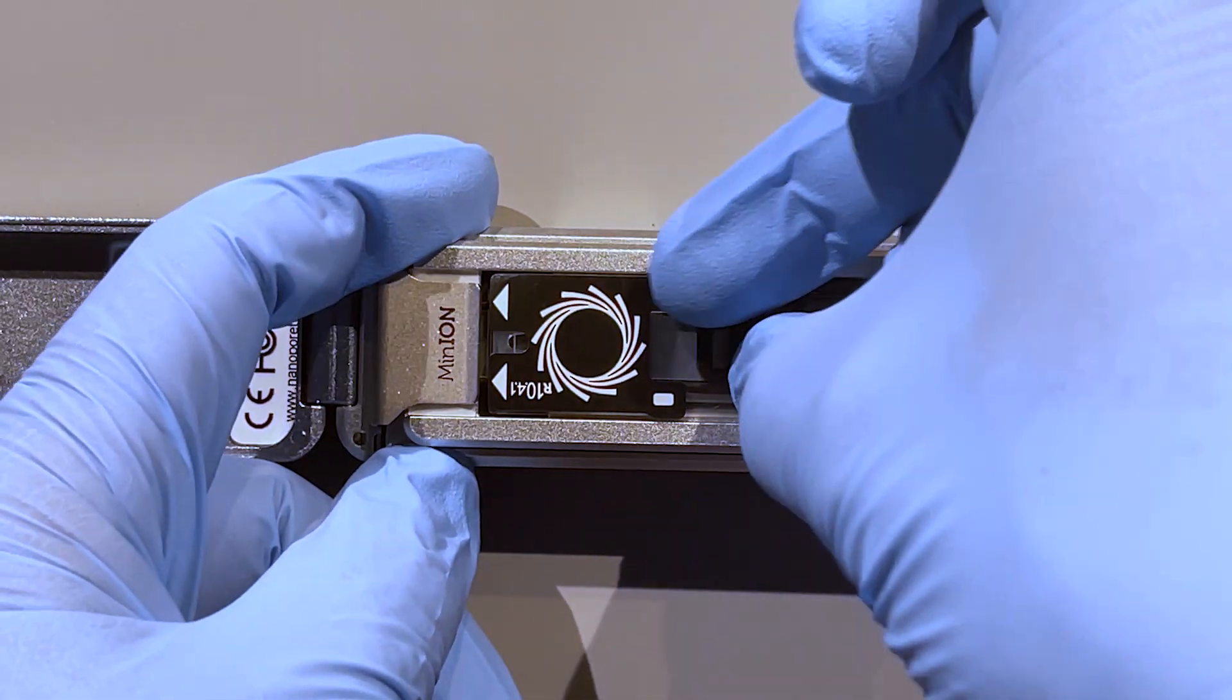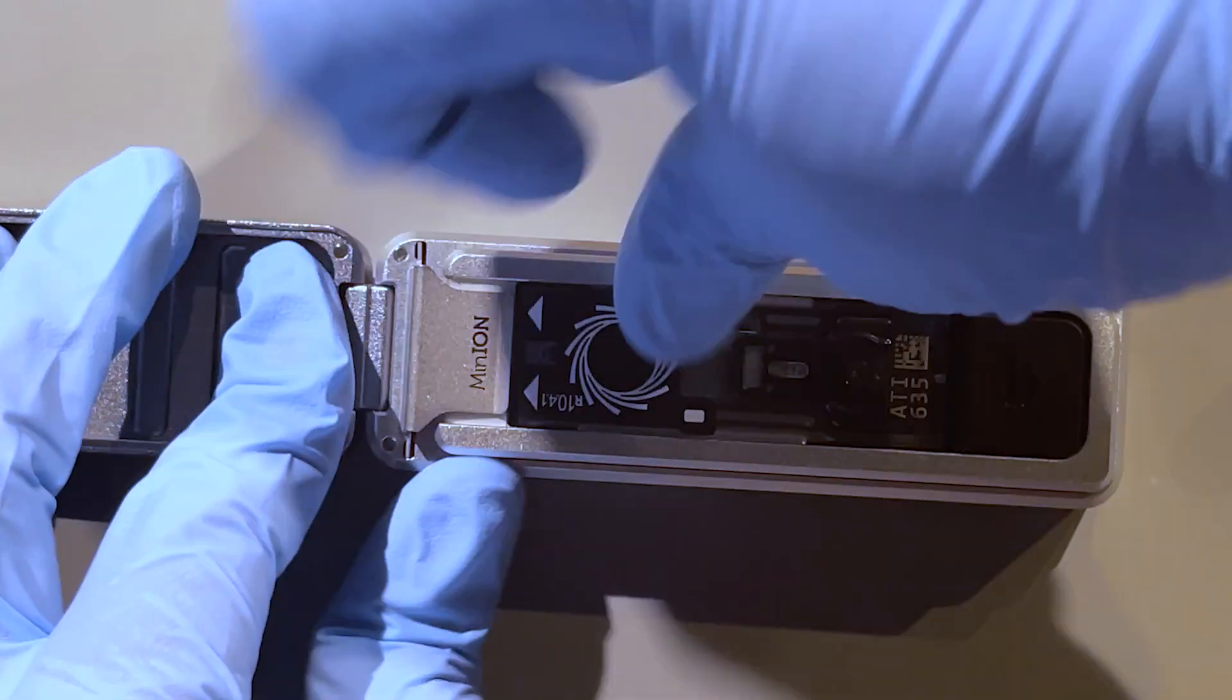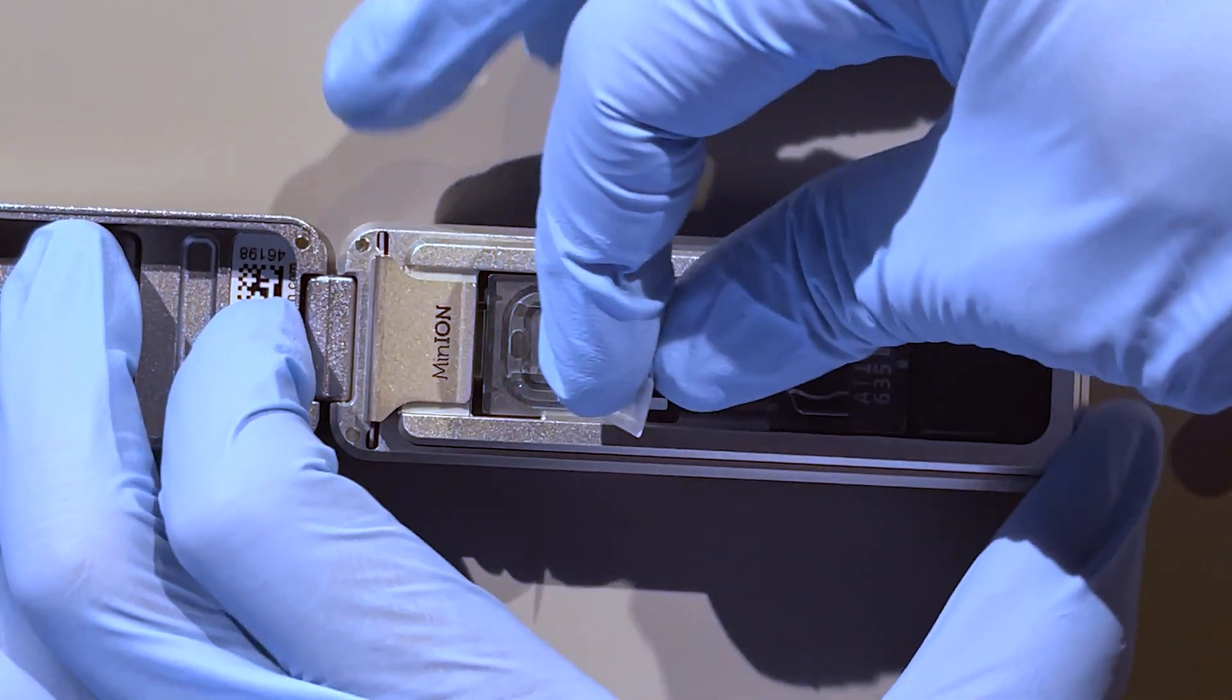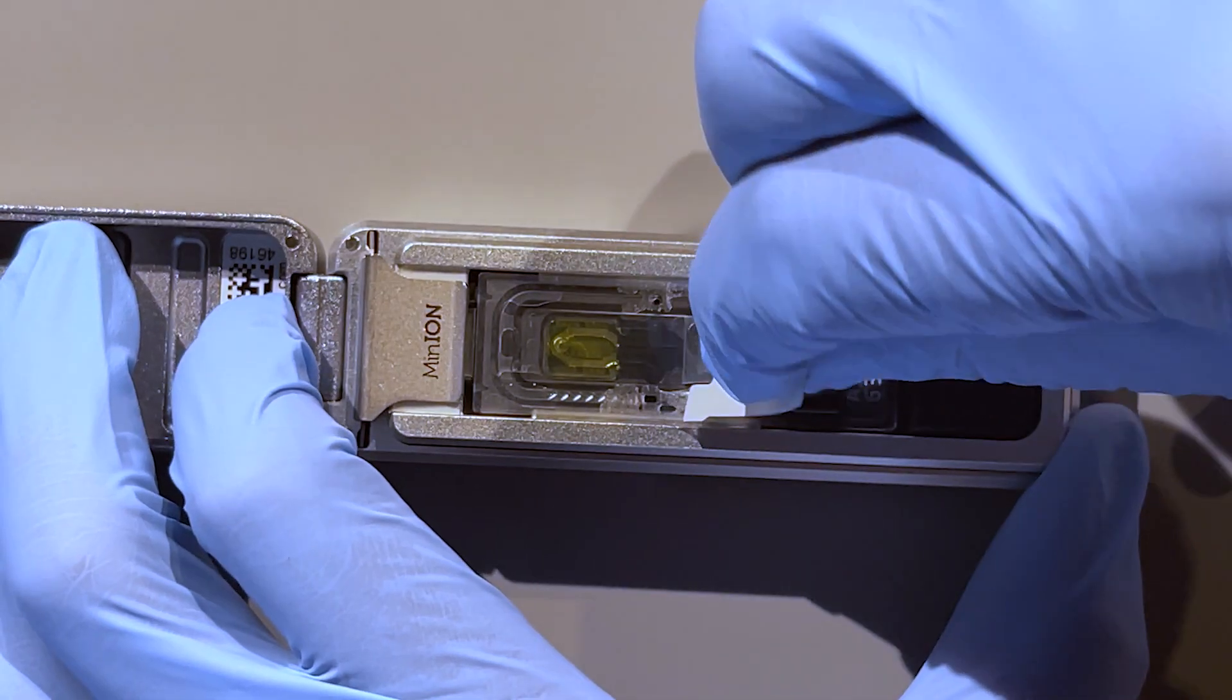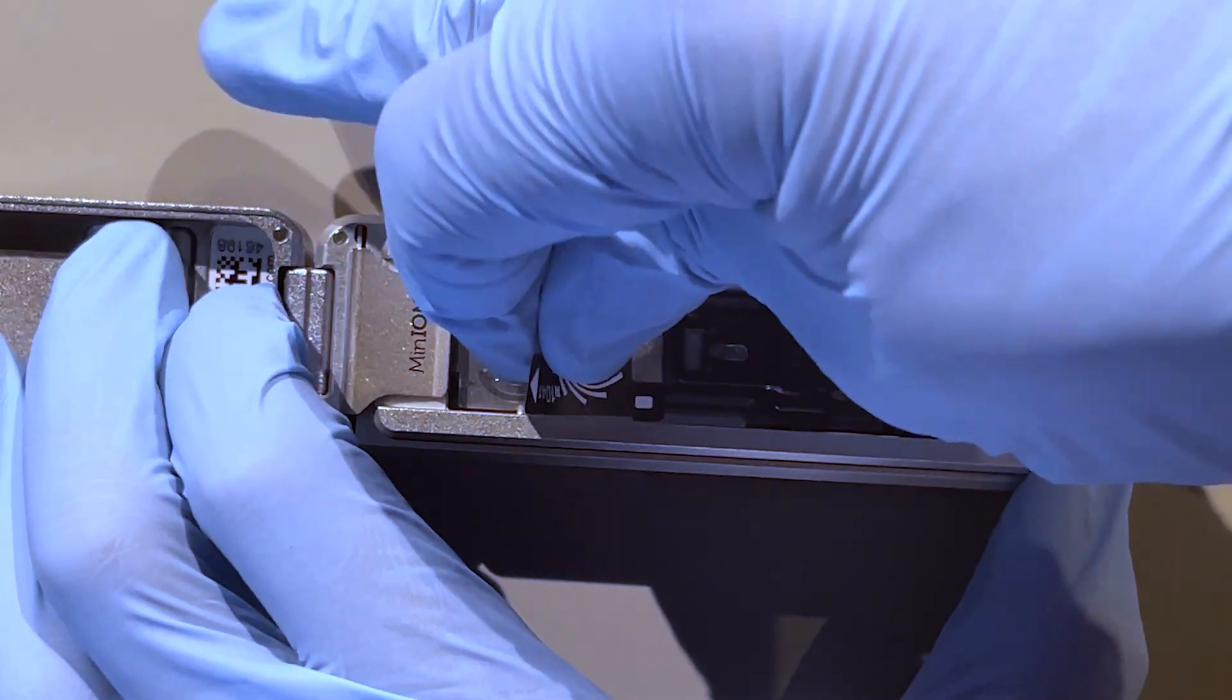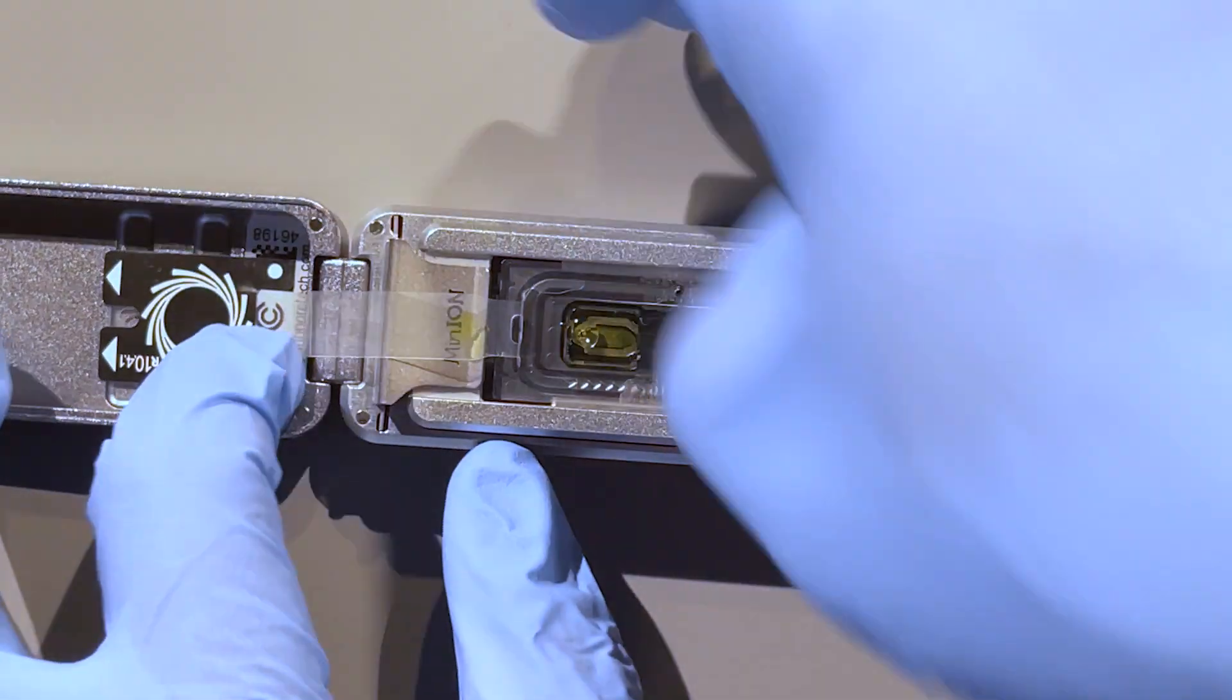And it also goes in at a bit of an angle till you feel it go in, and then you press down. You'll hear a click, and that is now in there. The flow cell has this tape that's at the top. So with these gloves on, I've got to figure out if I can get my finger underneath of it. This has so far been the hardest part of the whole procedure. Okay, so I take the tape and I peel it back.